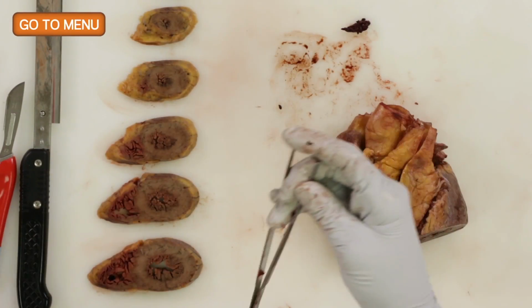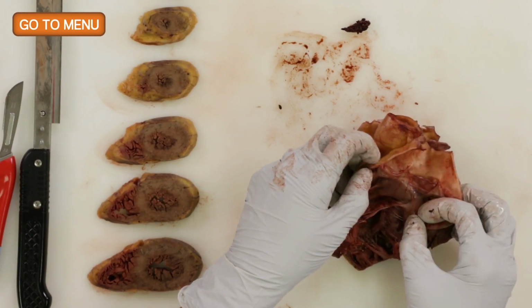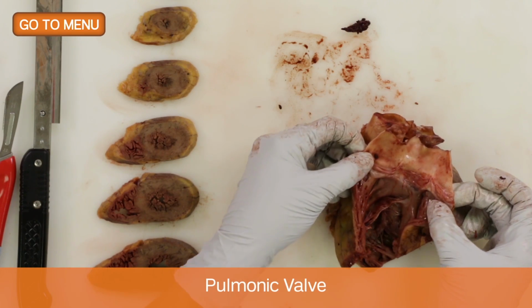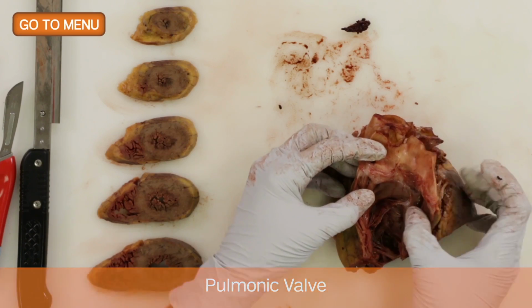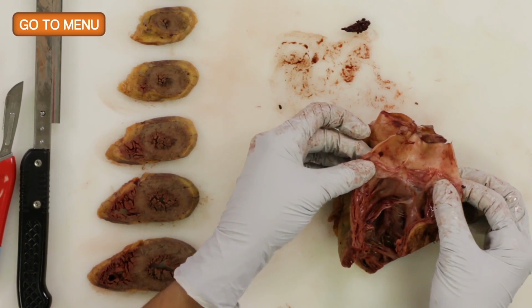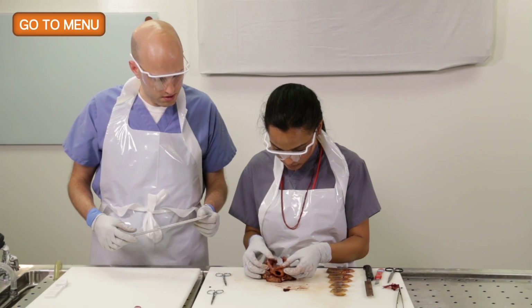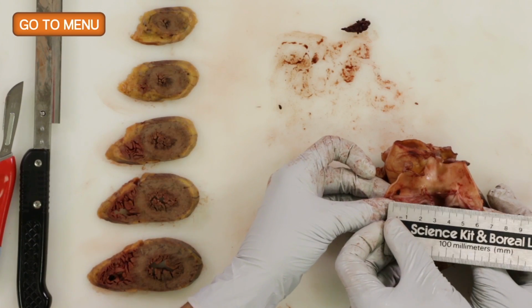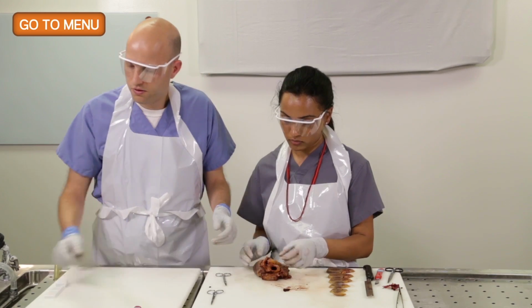All right, very good. So now we have the entire right heart open, and you have a look at the pulmonary artery. How many cusps in the pulmonary artery? There are 3 cusps. And do you see any vegetations or abnormalities with that valve? No. All right, so let's measure. So it is about 6.9 centimeters.